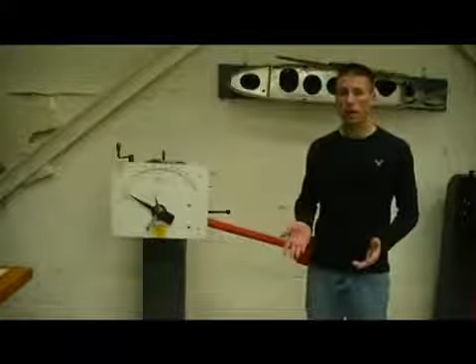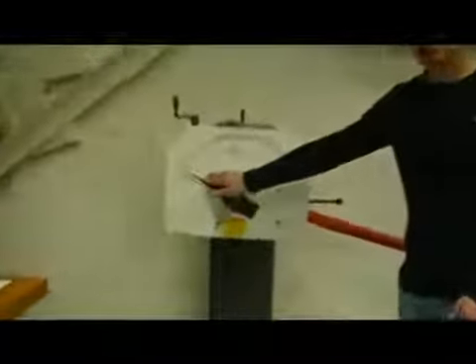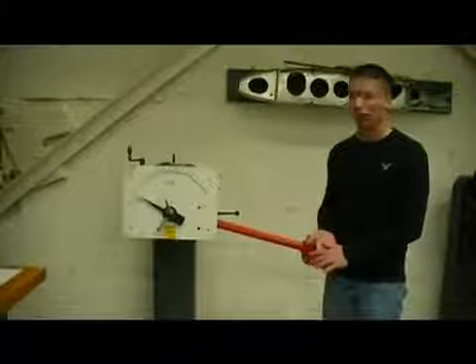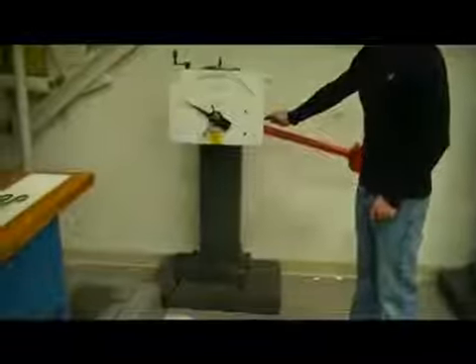With the sample now mounted, we're ready to begin the test. Again, remember to make sure that the dial here is past the end of the scale so that we get an accurate reading. Also, double check to make sure there's nothing in the way of the swinging pendulum as it comes down, otherwise it'll ruin the results of the experiment. With everything ready to go, we'll push the handle towards the wall and begin the first test.